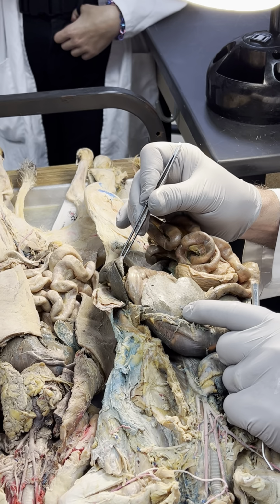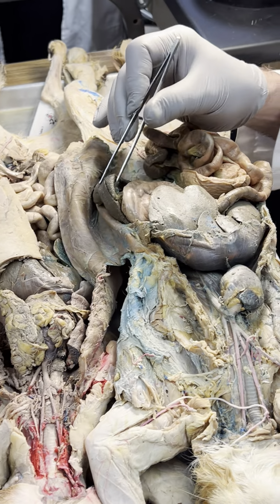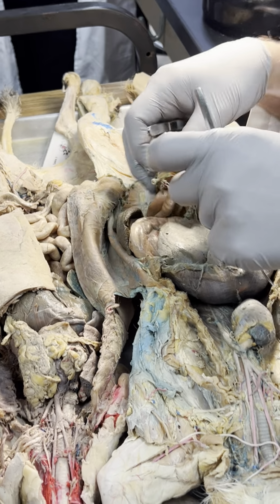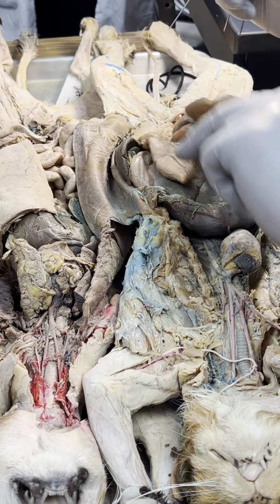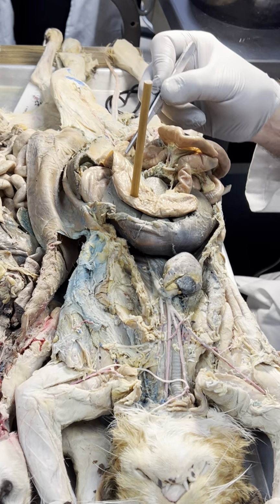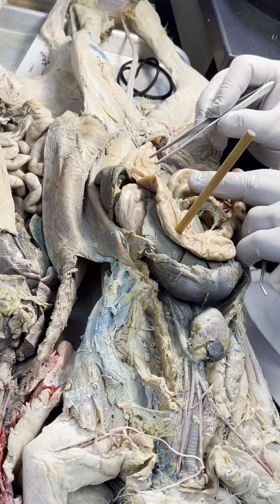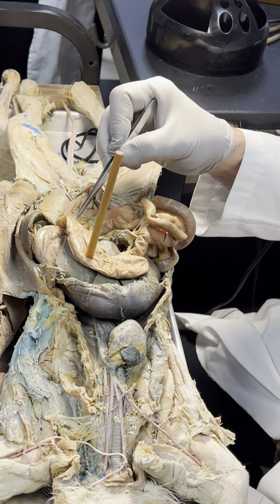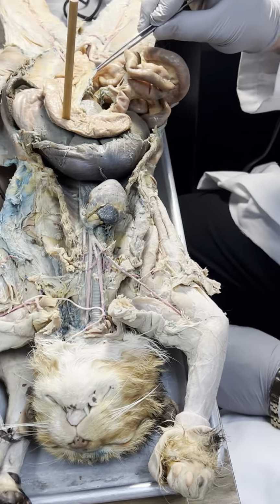What's this guy? Spleen. Why? Because the left side, left lateral gutter. Spleen. You definitely see one of the cats where I did that. What's that? Colon. You don't need to know the levels. You just need, that's all colon. So you would pin it here? No, I could pin it anywhere. So what's that? Mesocolon.